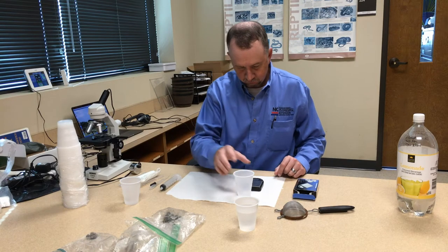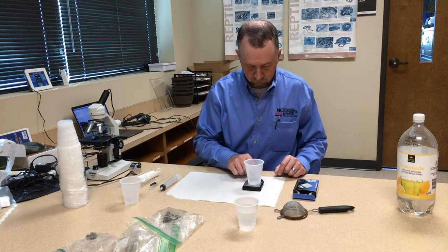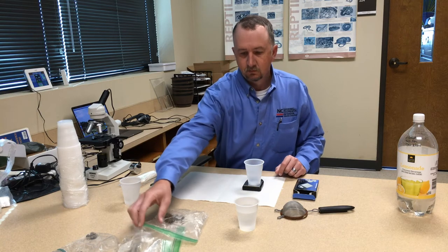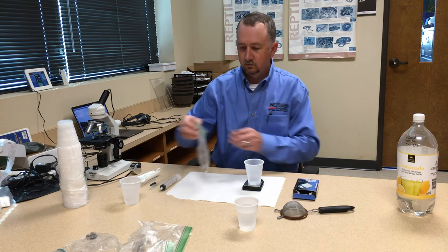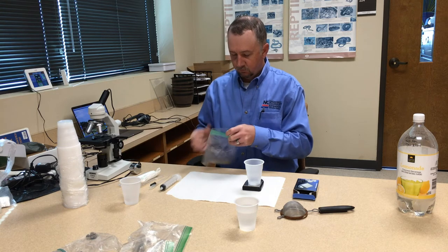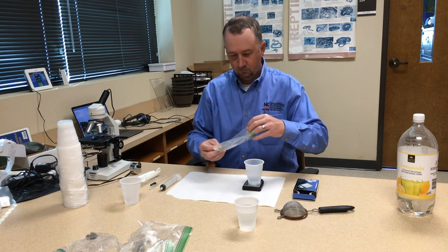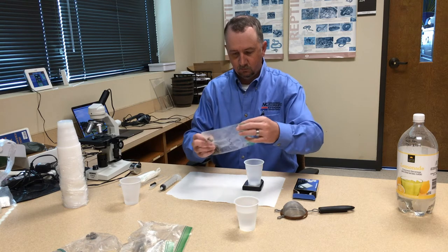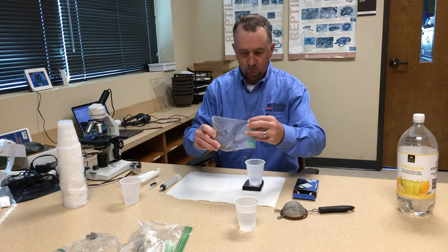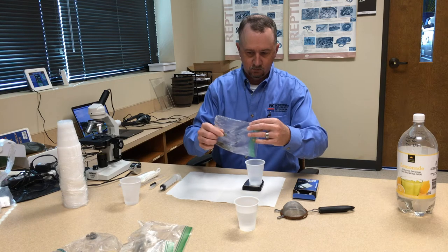I personally prefer to weigh out my sample rather than using a cylinder, although that certainly works. You zero out the weight of the cup and add 2-4 grams of feces, and I always like to be as close to 4 grams as possible whenever I do a sample.